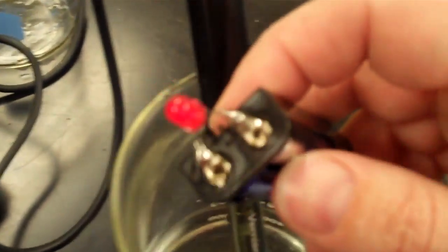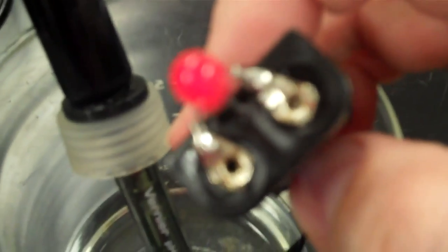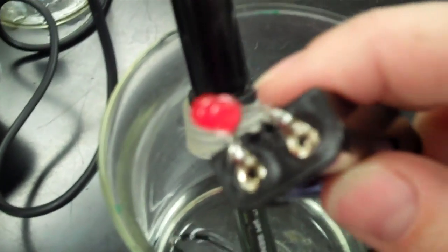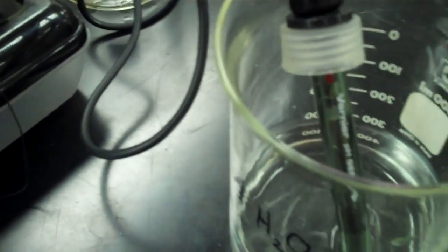Now let's think about everything we know about conductivity and electrolytes, and we place the conductivity tester in, and we turn it every other direction, and no matter what I do, I do not see it lighting up. What does that tell us about if it's conducting electricity, its conductivity, or if it's an electrolyte? What does that tell us?